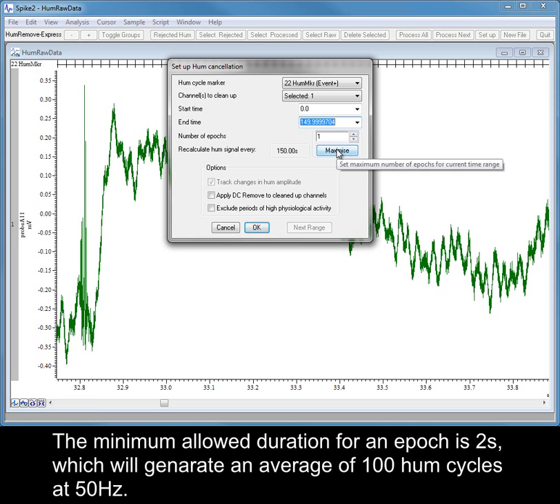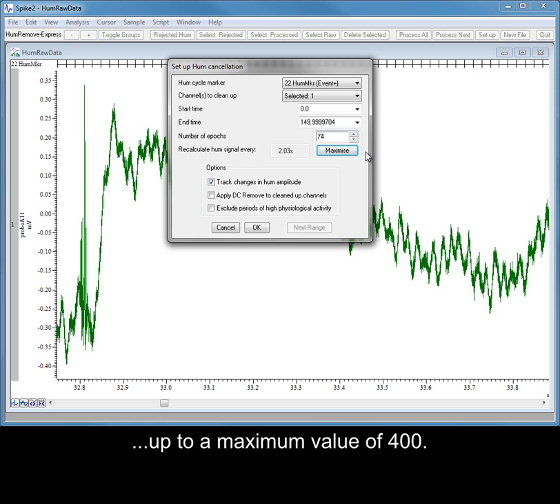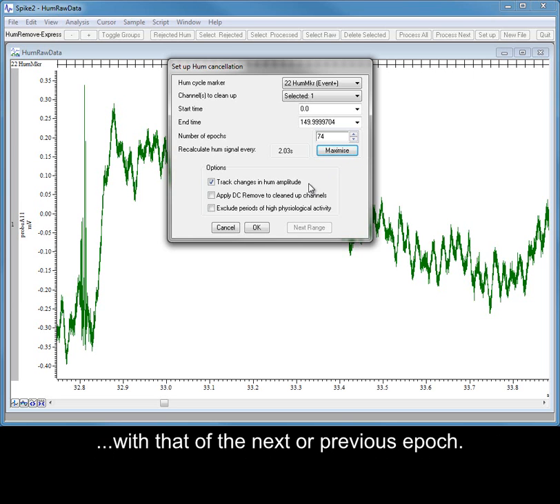The minimum allowed duration for an epoch is 2 seconds, which will generate an average of 100 hum cycles at 50 Hz. The Maximize option sets the maximum number of epochs available based on the minimum duration and the selected time range, up to a maximum value of 400. When using multiple epochs, there is the potential to introduce a step change in the reference average and waveform between epochs. Selecting the Track Changes option avoids this by subtracting a reference signal that is a weighted average of the reference of the current epoch with that of the next or previous epoch.